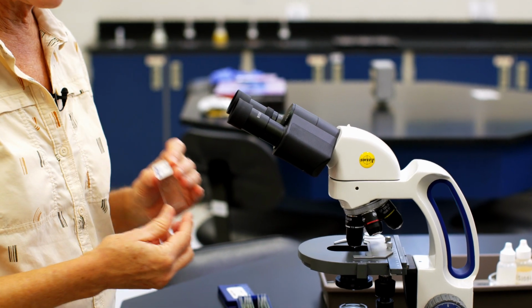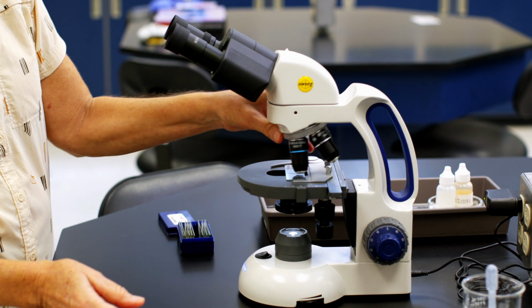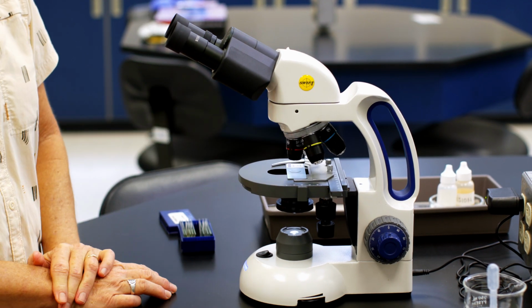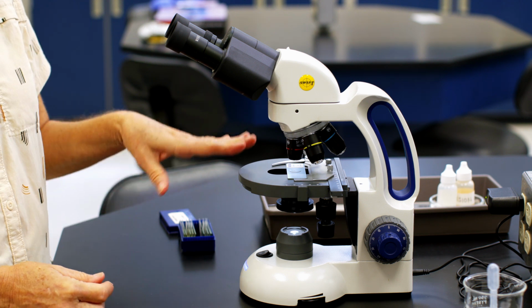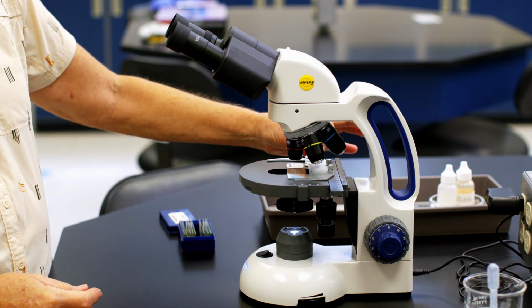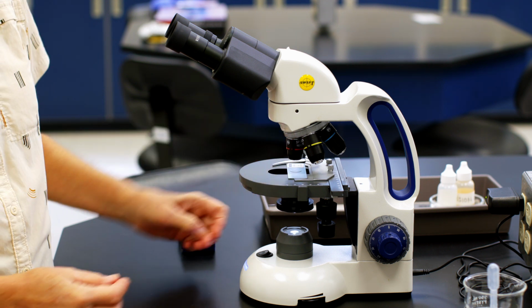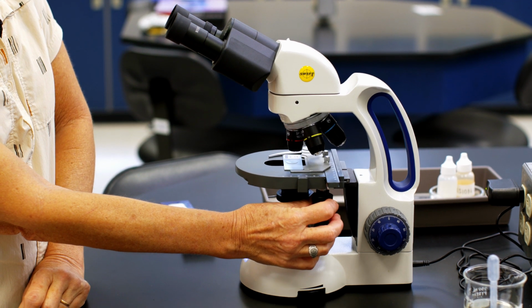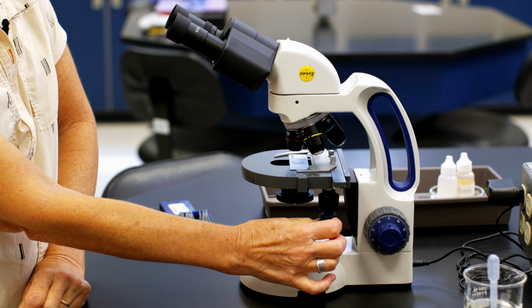These are permanently mounted slides, and you would put that underneath, starting with the lowest scanning lens. We'll go through the way it works in a little bit. I just wanted to show you the clip, which is this part. It's going to clip the slide in. You slide it in, and that allows you to move the slide around using these little knobs on the bottom.